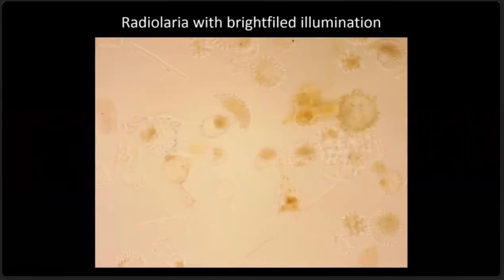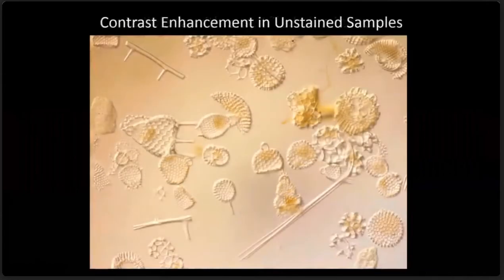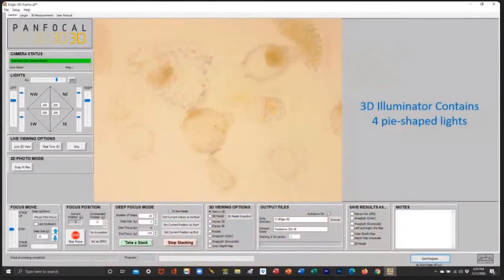So let's look at this Radiolaria with bright field. This has got all 4 lights on it, basically one standard. This is a bright field image, and you can barely see what's happening. But look what happens when you turn one single oblique light on from the northwest. Now all of a sudden, wow, it's like night and day. Now you can see every little bit of these little microorganisms with good contrast, and the stacking gives you incredible depth of field.